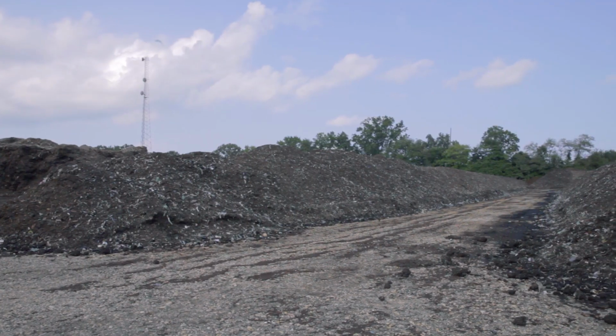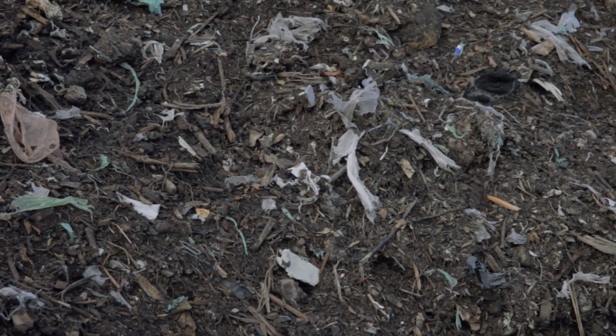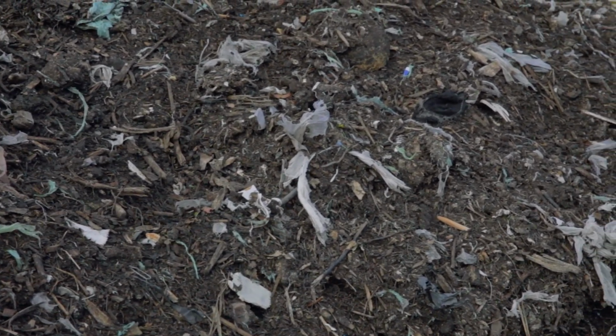CCREF has received feedback from some labs that composts and feedstocks with a higher degree of physical contamination require a greater amount of sample for analysis. It is our recommendation that if levels of inerts in compost or feedstocks sampled for analysis are higher than typical, the sampler send 3 to 4 gallons of finished compost for analysis.